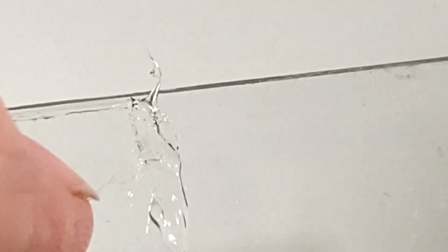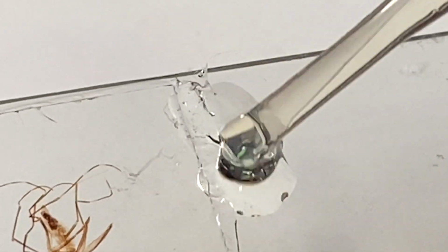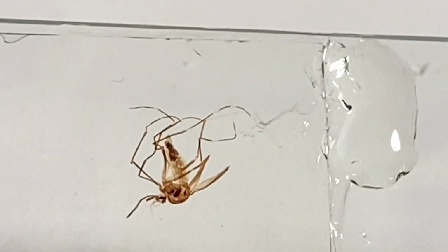Hopefully. And I'm going to put a little bit more just in case it sucks back in again. There we go. So I'll consider that a success. So that one slide that I considered not to be acceptable because I had a bubble right in the middle, right in the viewing area.